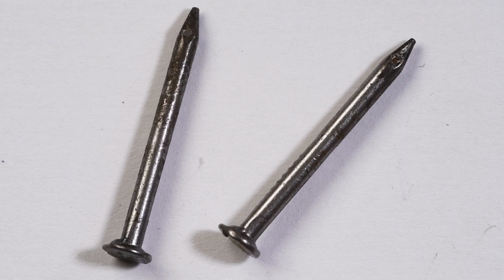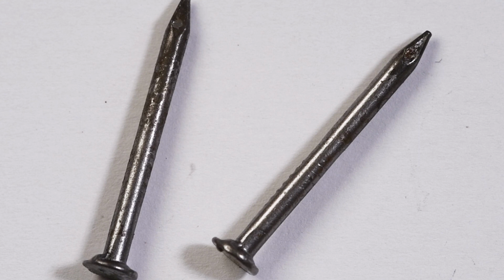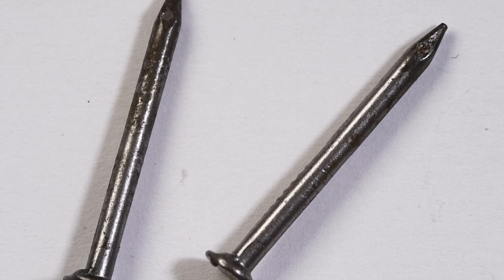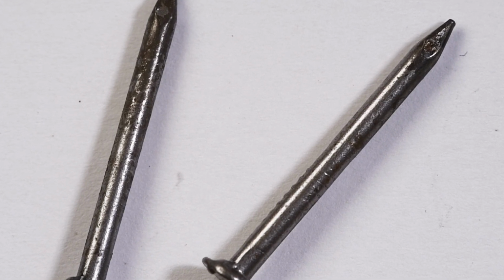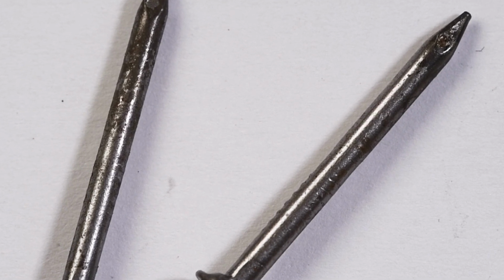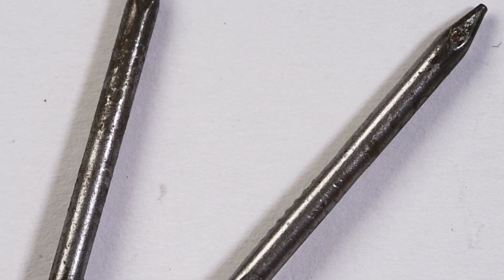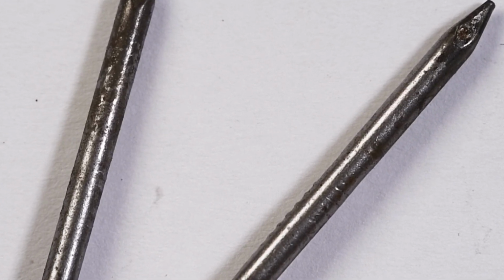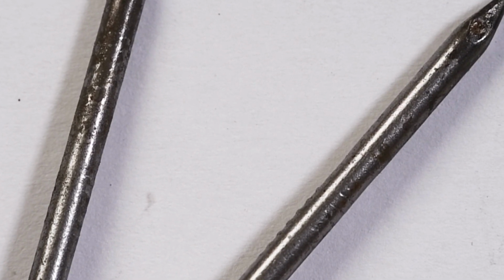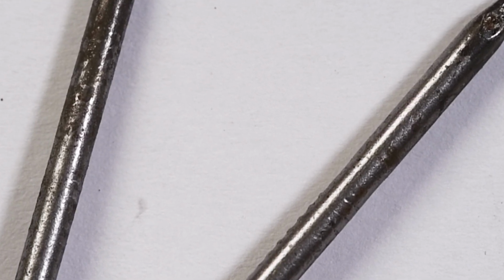Now we've got the nails that were in the boiled water, so they had water but no oxygen. You can see these have reacted a little bit. There's a little bit of discoloration. That would be because just by boiling the water we didn't get rid of all of the oxygen that was dissolved in the water. So there's this very slow reaction, but definitely not as much rust as with the air and water mixed together. So we can see that just having water but no oxygen does not cause iron to rust.